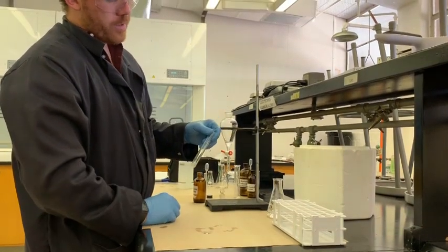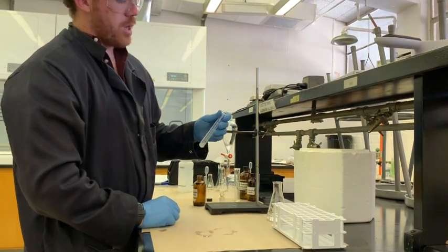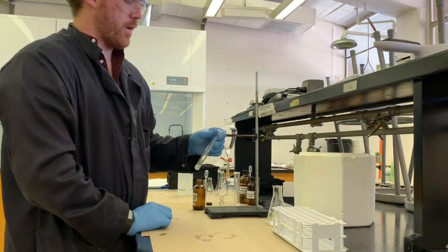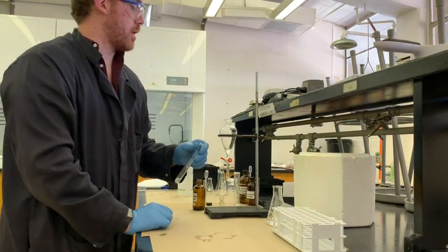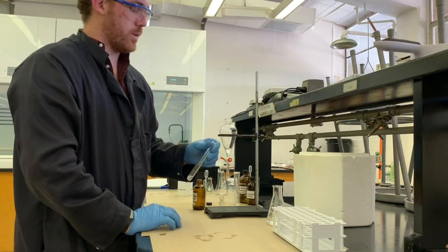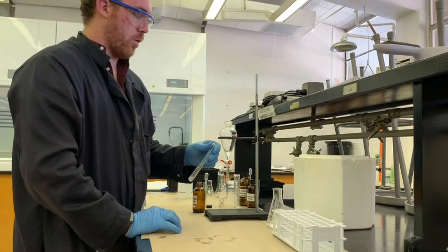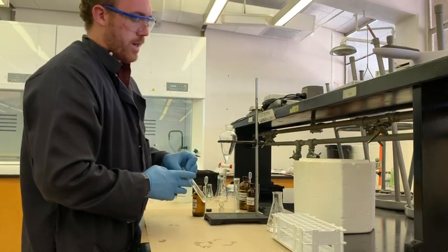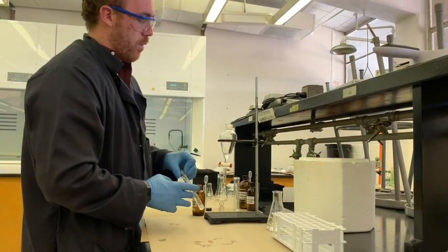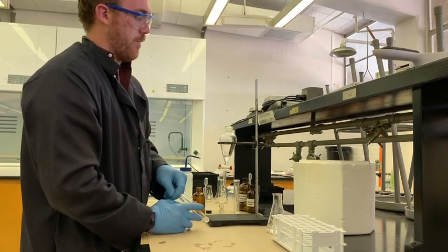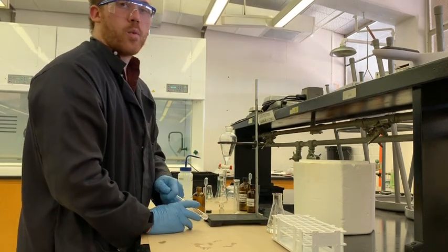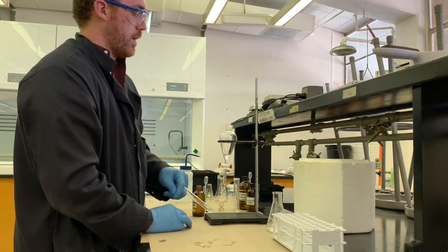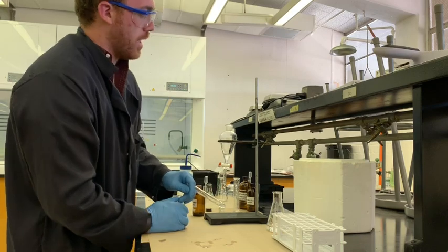Now what is the interference here that could have happened? Maybe there was hydrochloric acid left over, that's what distillation would probably help get rid of. Maybe if we had dried this first with calcium chloride, that could have created some residual chloride lying around. But we could always do other different kinds of tests to figure out what it is. So tert-butyl chloride will have a different melting point, a different boiling point, a variety of different properties that we could also determine its purity and or identity with.